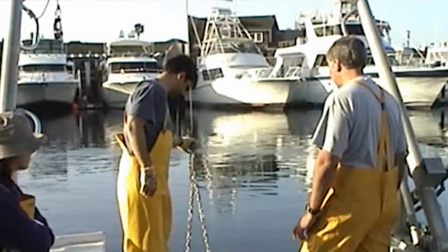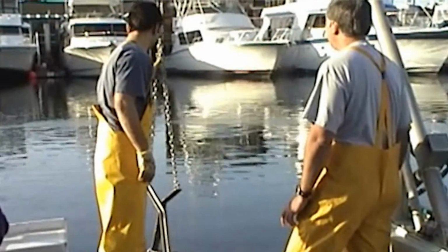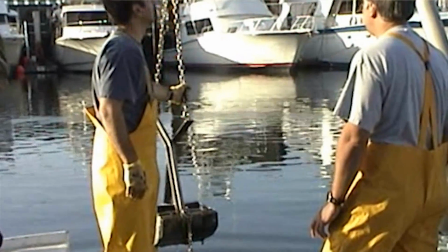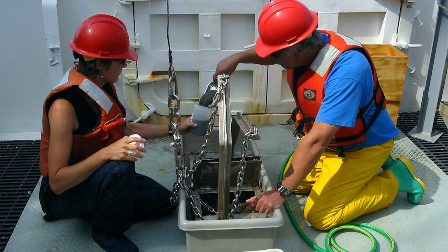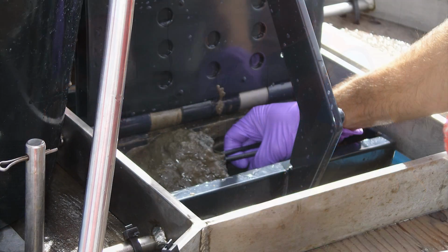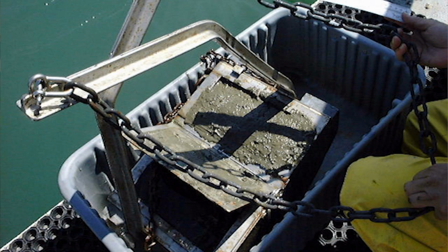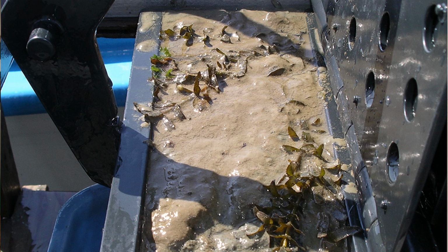In order to measure sediment quality, we need to collect samples from the environment and bring them back to the laboratory for testing. So we collect these samples on board ship using a grab sampler. And we take that sediment sample and we partition the samples into containers for chemical and toxicity analysis. Or we'll take the sediment and pass it through a screen that separates the sediment particles from the animals, then preserve the animals and identify and count them back in the laboratory.